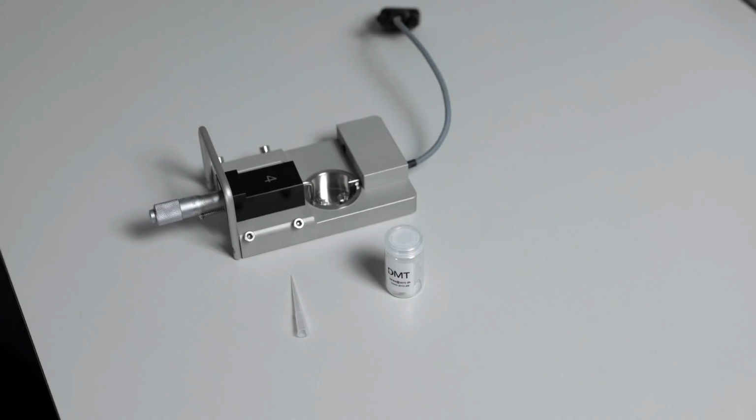The first method is a quick and easy way to reapply the exterior grease that may have been removed during the cleaning process. If you are experiencing what we call transducer drift or unstable force readings, then you may want to do the more involved method, which requires removing the transducer.